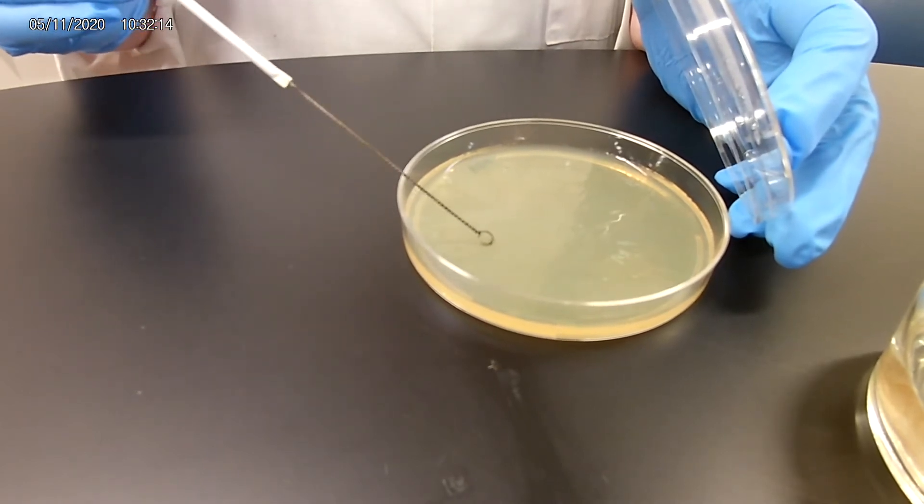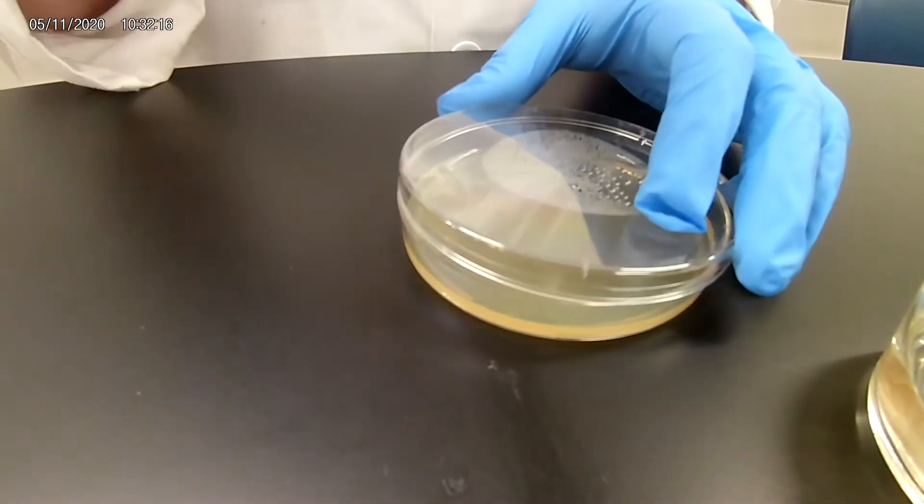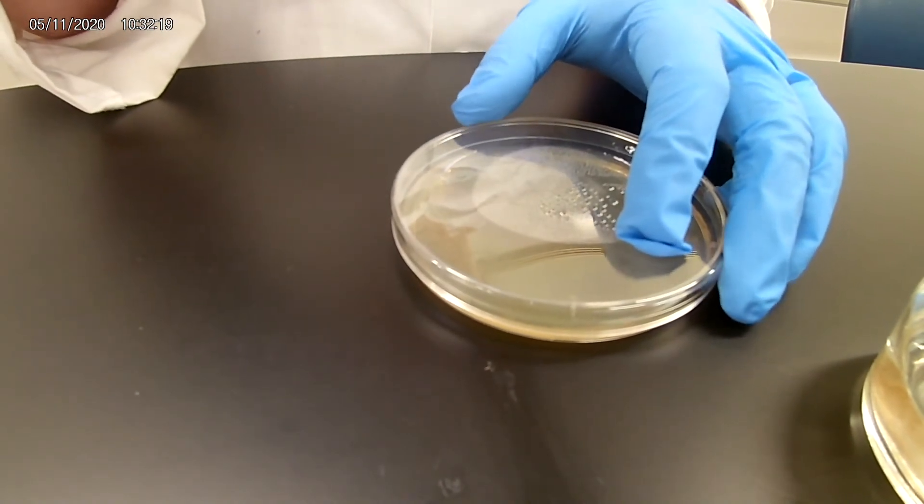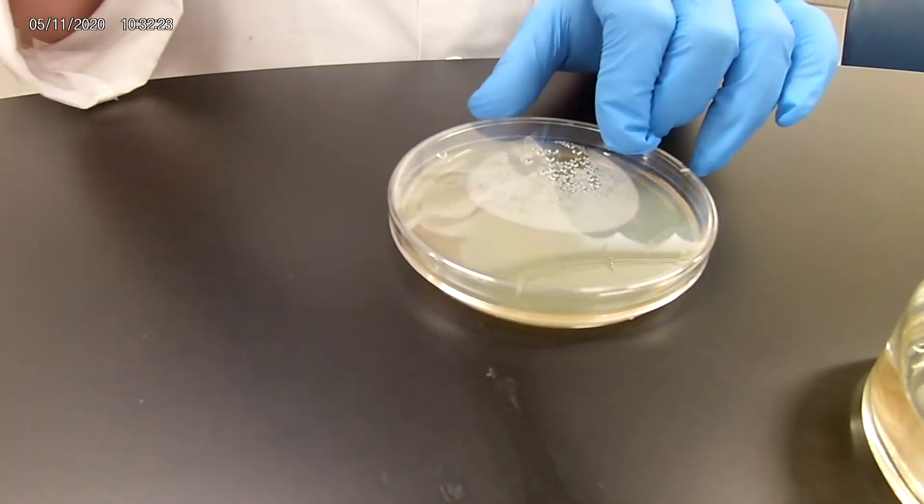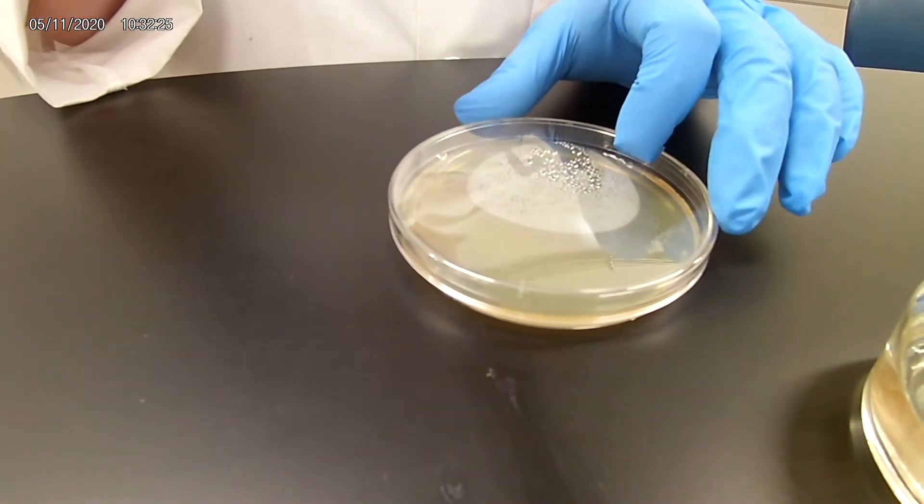We are spreading the organism out, flame our loop again. Now some people, if you've got to keep track of where you have been, they will turn the plate to roughly 90 degrees.